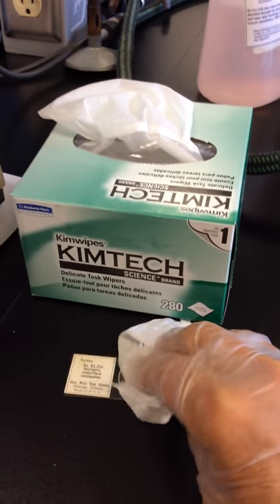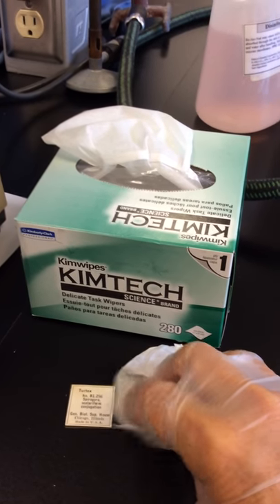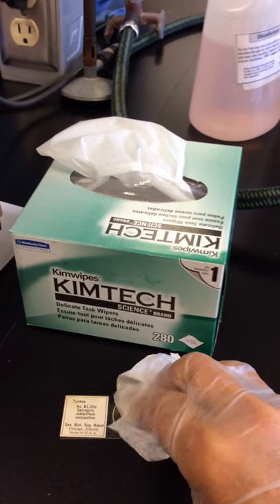If the slide comes from a slide box or a tray, we want to make sure that we replace it properly, face up, not upside down.